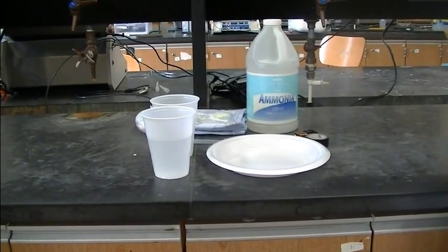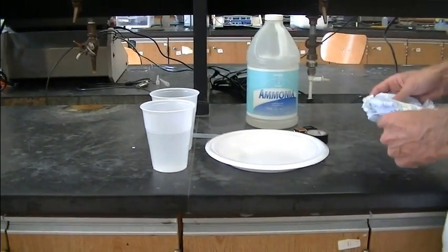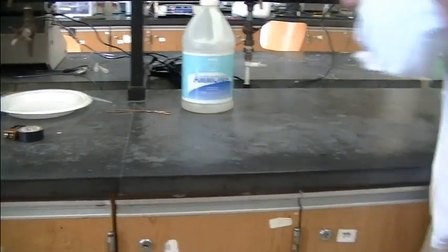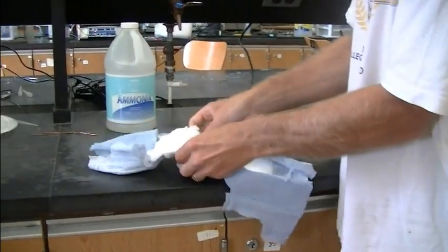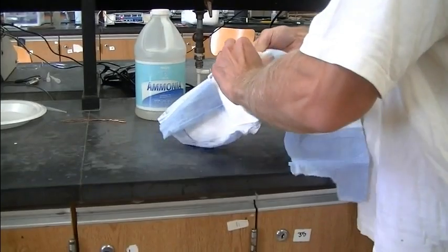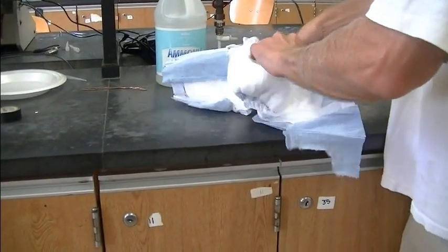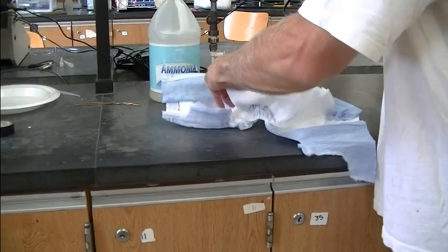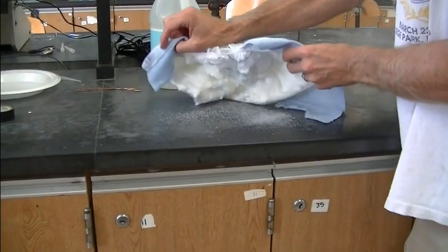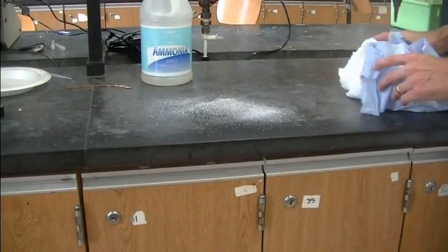The first part of this experiment is going to be to extract sodium polyacrylate from the diaper. And here's how this is done. You simply rip open the diaper. And then you want to take the pad that's in the middle and you want to rip that out too. And when you do that and turn it upside down, those crystals that fall out are crystals of sodium polyacrylate.